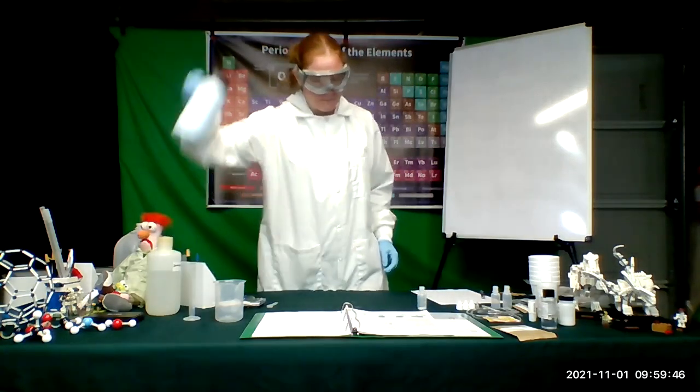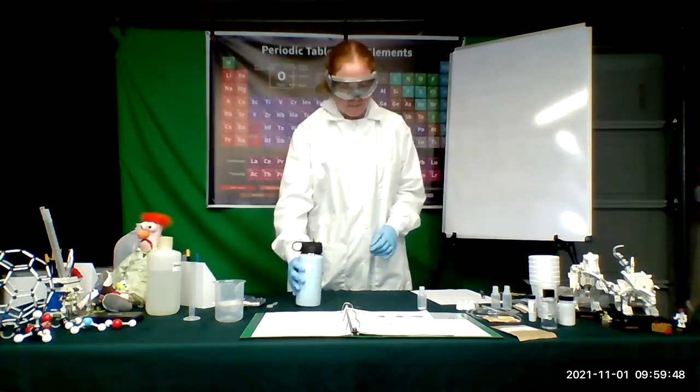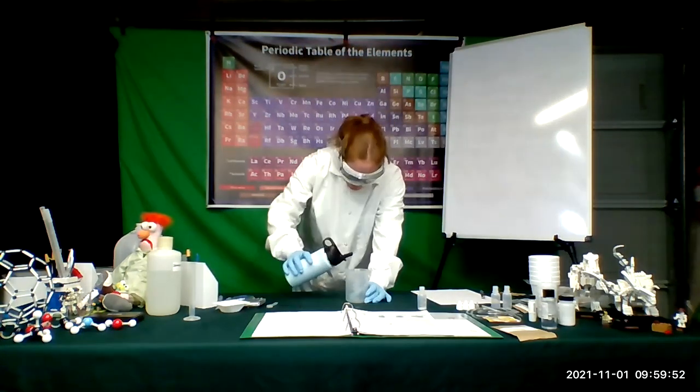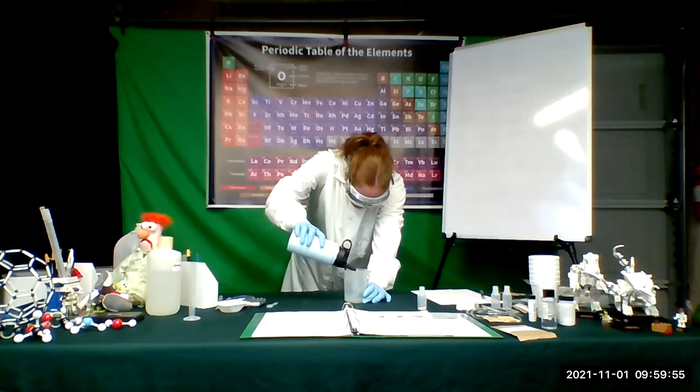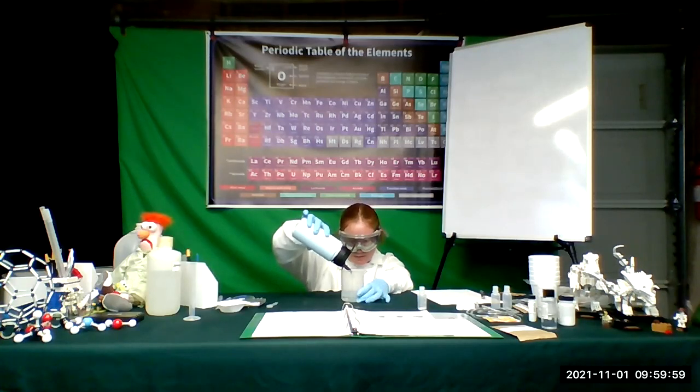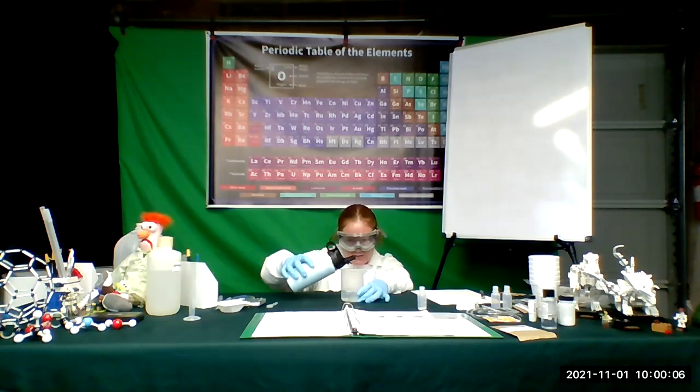Right now I have my hot water right here, and I want to add some water — approximately 125 mils of water to my beaker. I used a thermal insulated cup to bring it out here. There's my approximately 120 mils of water right here.